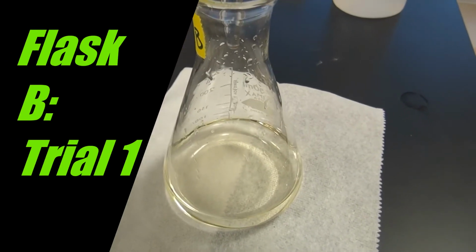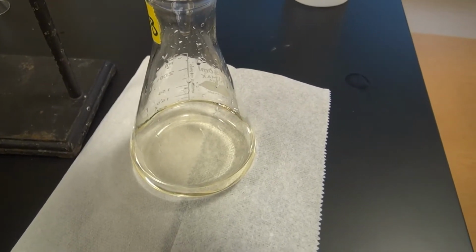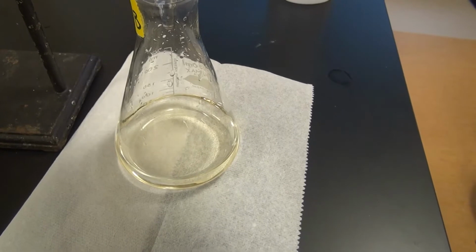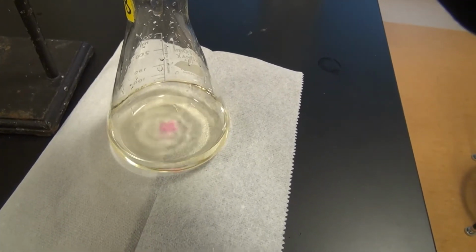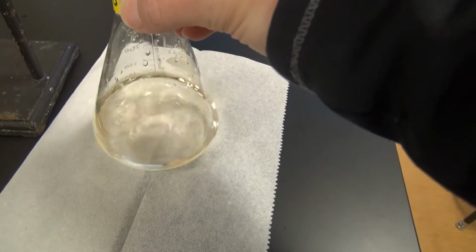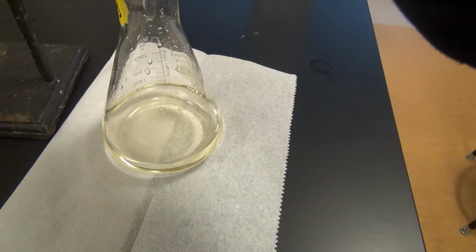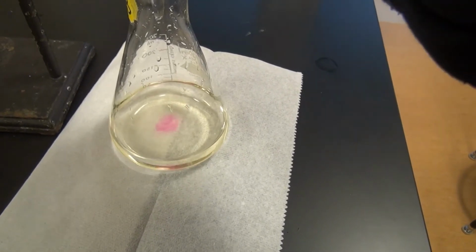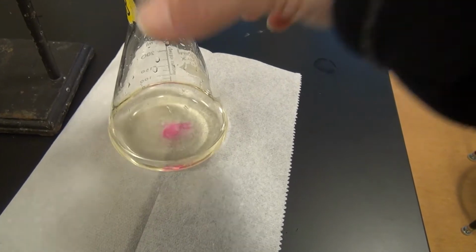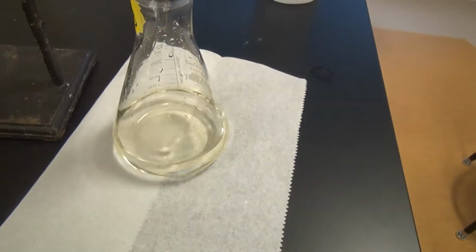Okay, so add 1 drop. I think we're a little ways away yet. 2 drops in there. Okay, so let's go ahead and record.